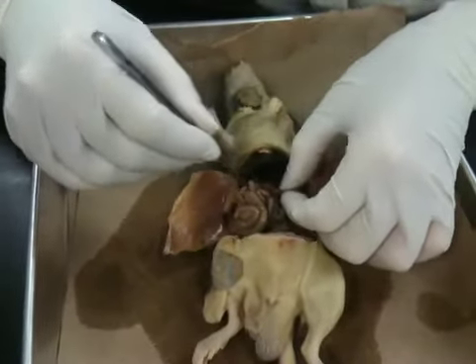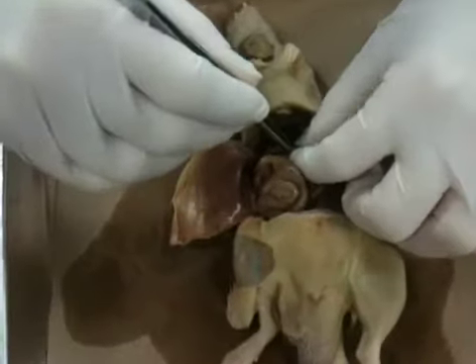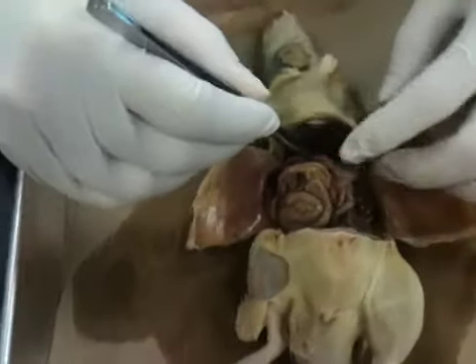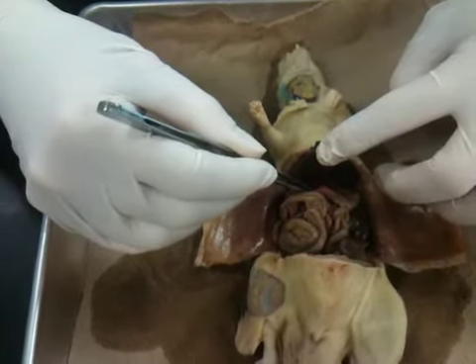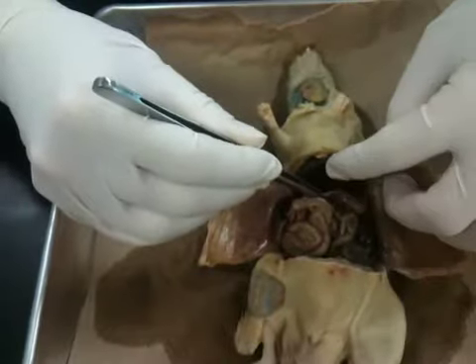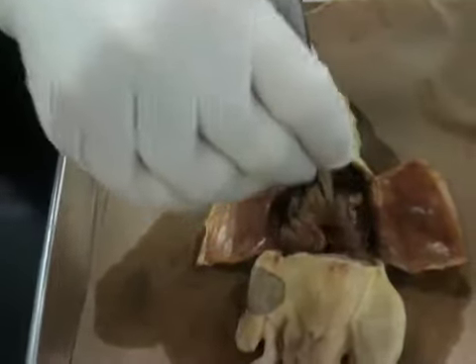Connected to the stomach then, we start into the intestinal area. You now need to know the different regions. Here's the first part of the intestine connected right to the stomach. Now, you can call this the duodenum or the duodenum. We don't care, as long as you spell it correctly. That's all we need. So that's this first part. The main part of the intestine then is the jejunum.